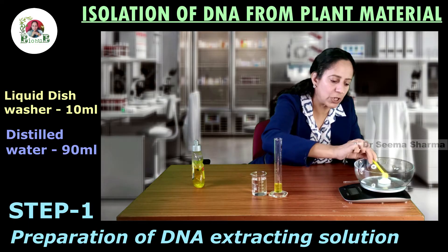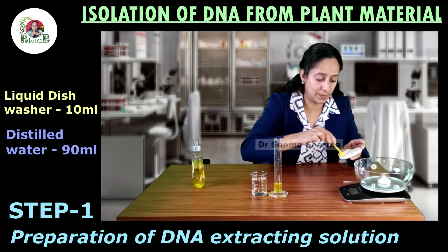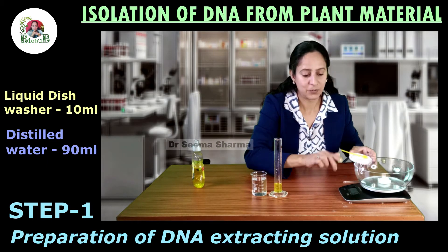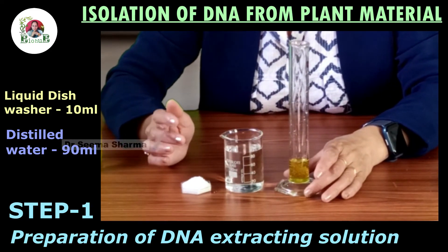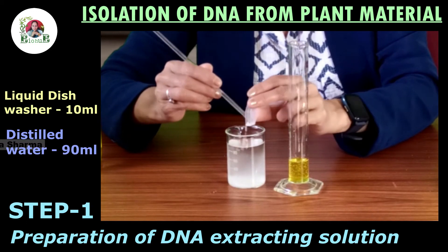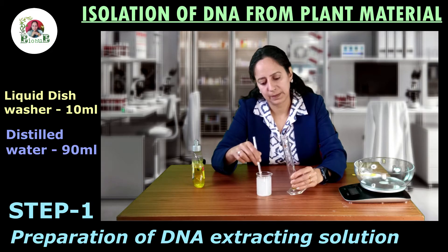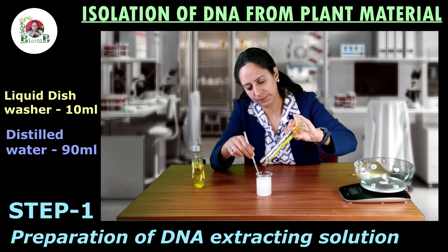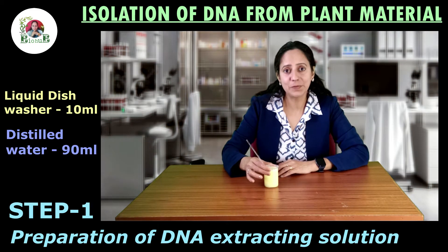You know viewers, the overall charge on DNA is negative. So to neutralize that negative charge, sodium chloride is added during extraction of DNA. Now this is 10 grams of sodium chloride. These are the three ingredients required for the solution. First, pour the sodium chloride into 90 ml of distilled water and dissolve it with the help of a stirrer. Then add the liquid detergent to it. Now this solution is ready.